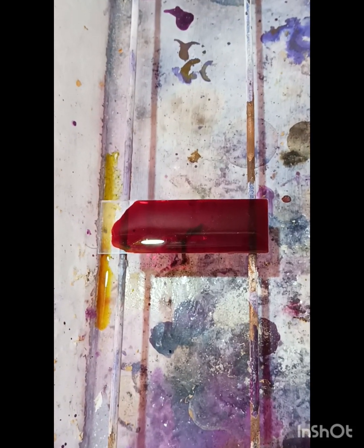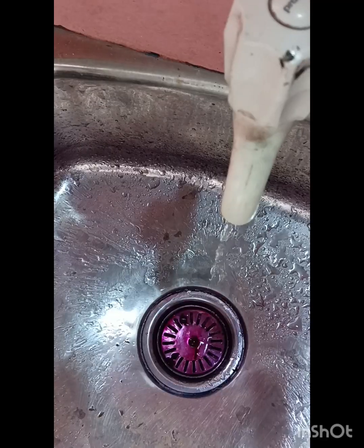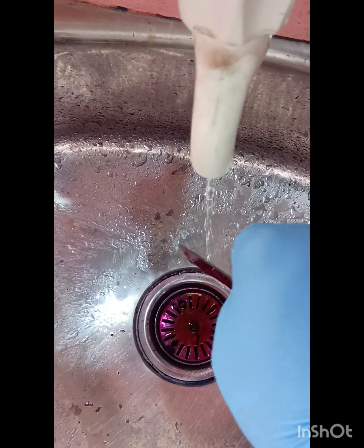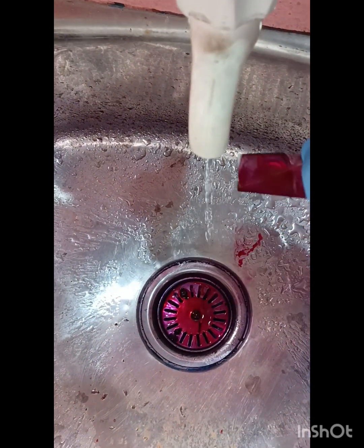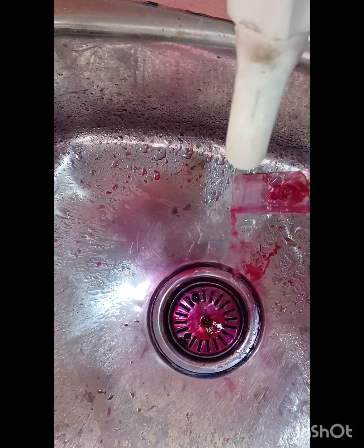Allow it to stand for 5 minutes. Discard the carbol fuchsin solution and wash it properly with tap water.